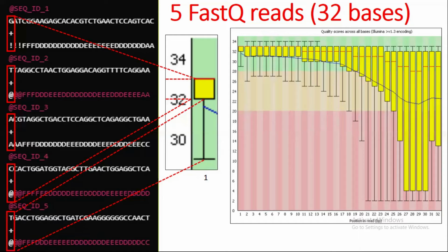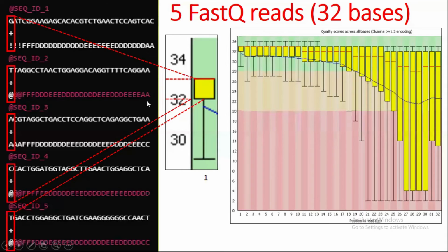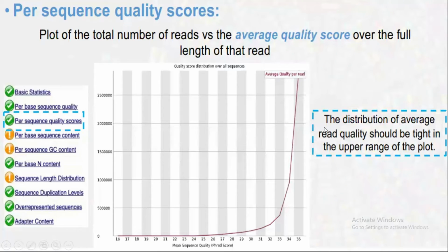Now we will proceed with the per sequence quality score. It's very easy. Basically, it just checks our sequences. In the statistics, I want to show you that our sequences number 4,834,426. This axis is the Phred quality score, and this is the number of sequences. It starts from 5 lakh and goes to 25 lakh.